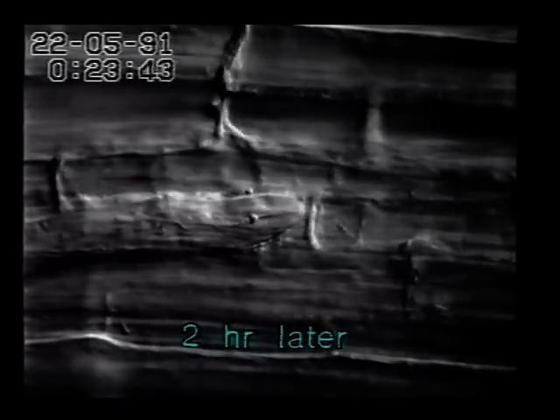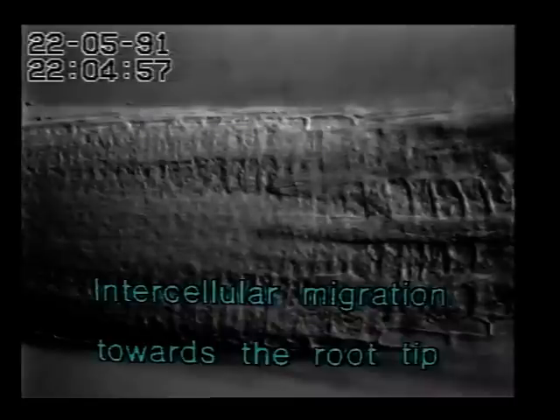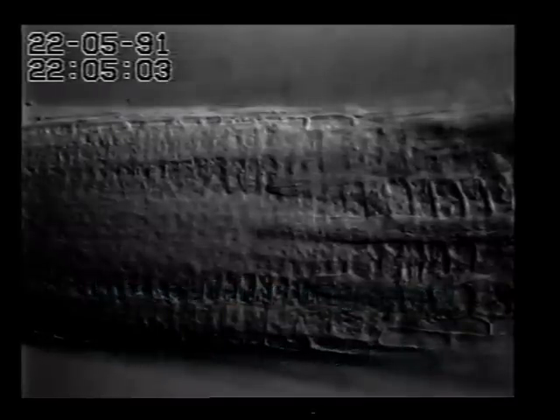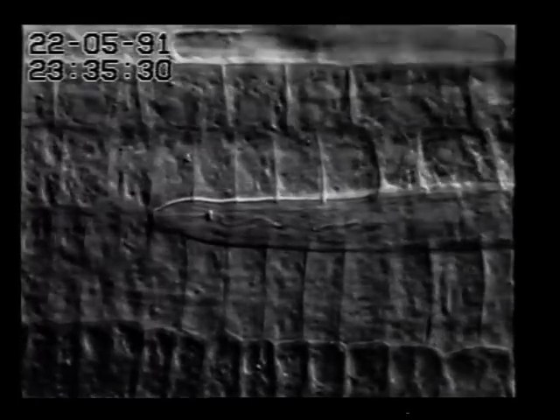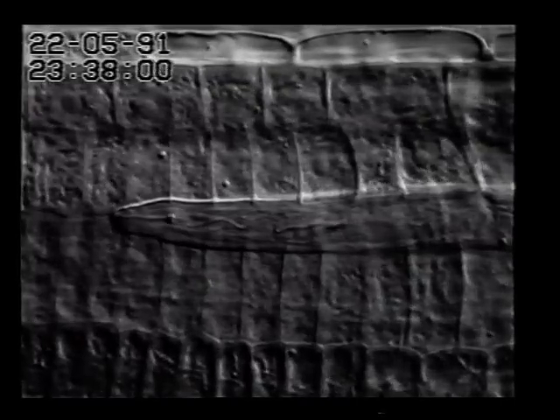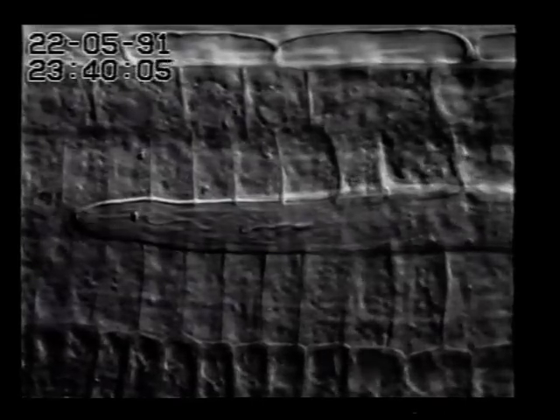Hours later, this juvenile is still trying to perforate this cell wall, however without success. The following scene now shows successful migration. Here are two juveniles migrating intercellularly towards the root tip. During migration, the plant cells are almost not affected by the nematode. Only the intercellular space is widened to provide enough space for forward movement. This time-lapse sequence shows that the speed of root elongation exceeds that of the forward migrating juvenile.